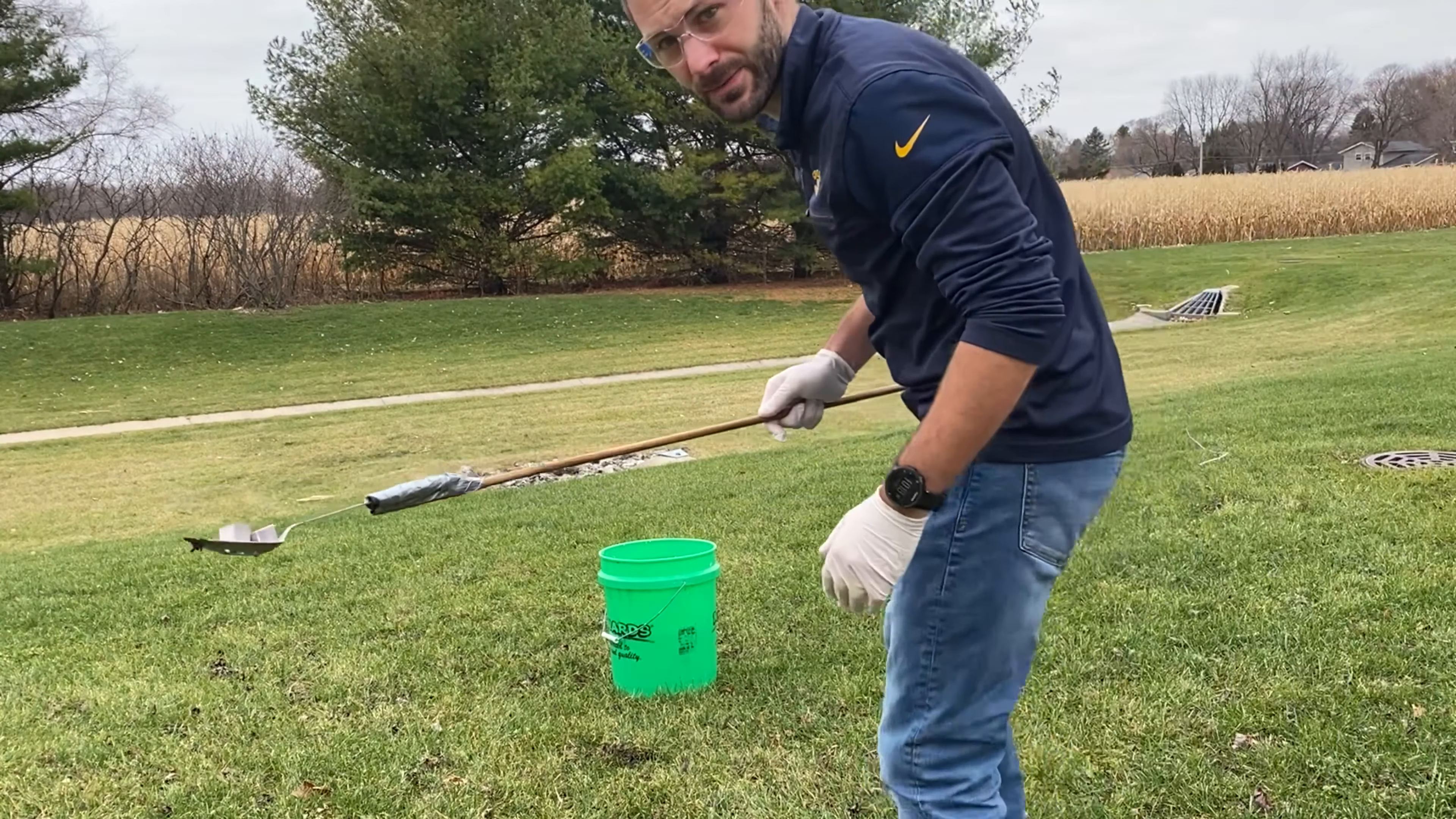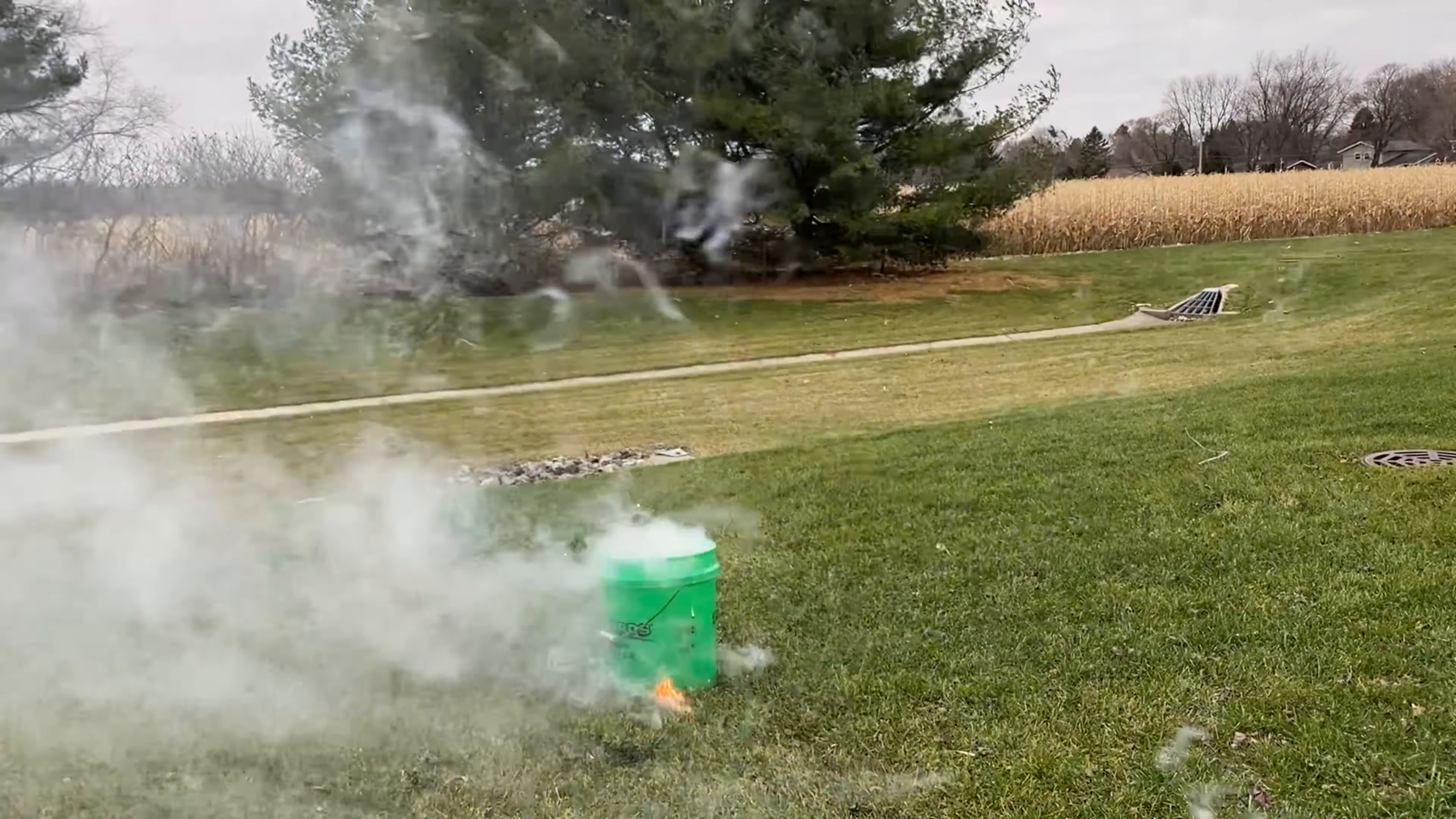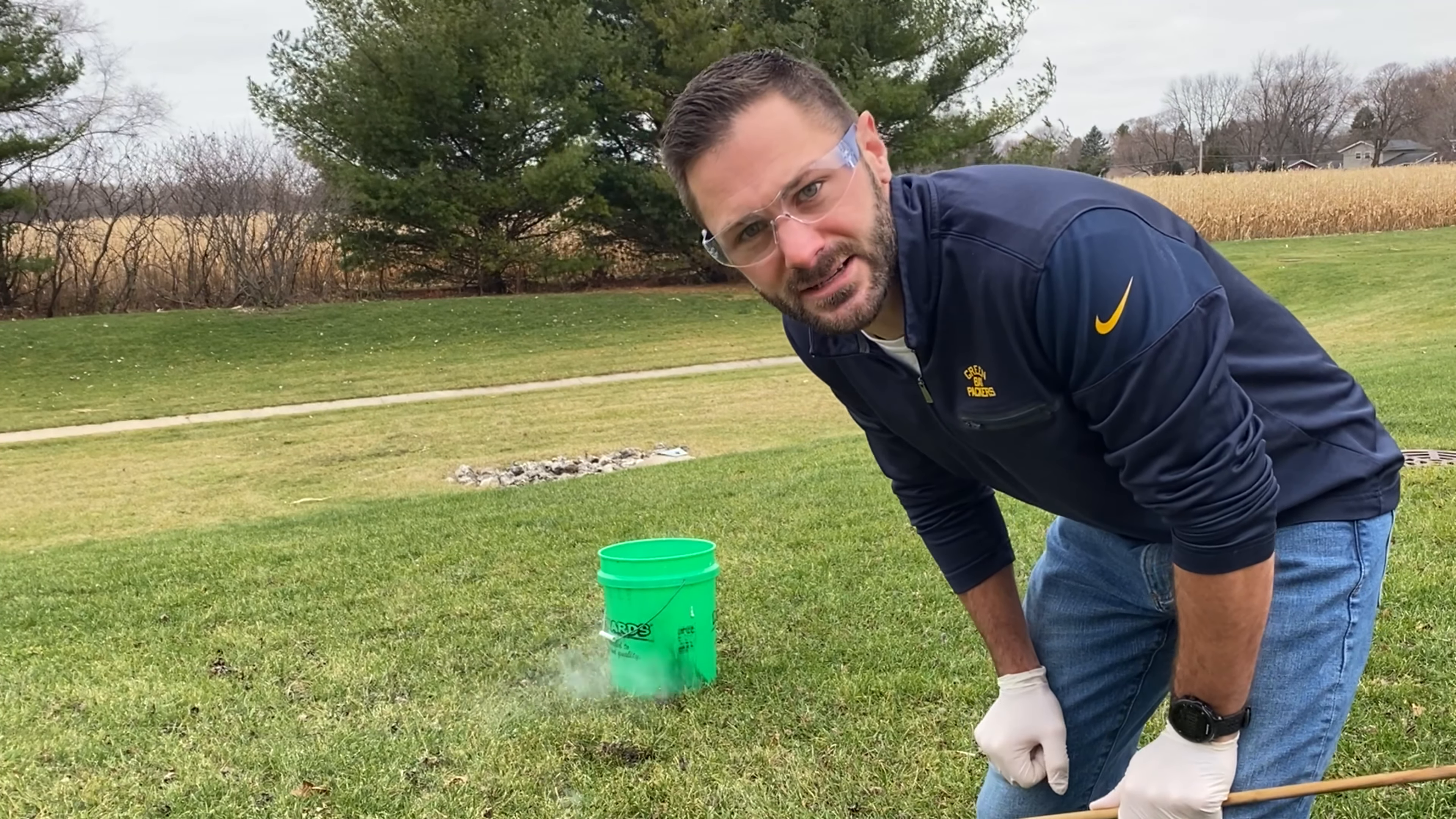Okay, now you can see I got two blocks in there. I'm going to go ahead and I'm going to drop them into this water here. Now, you can't see into the bucket, but you can observe sound, and you can see what happens from far away. Here we go.